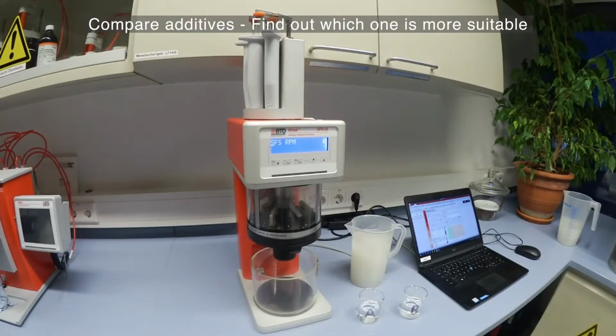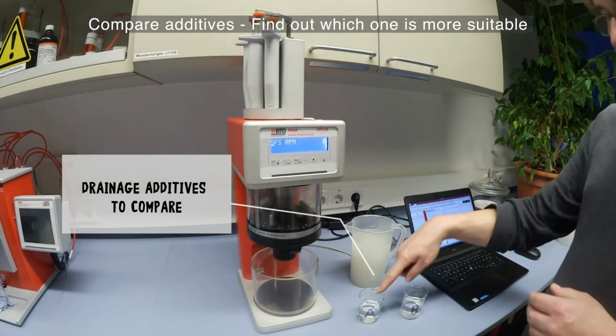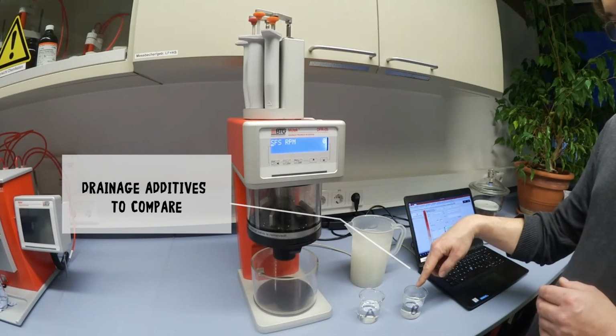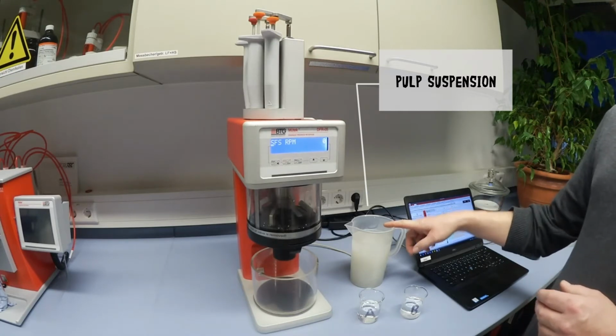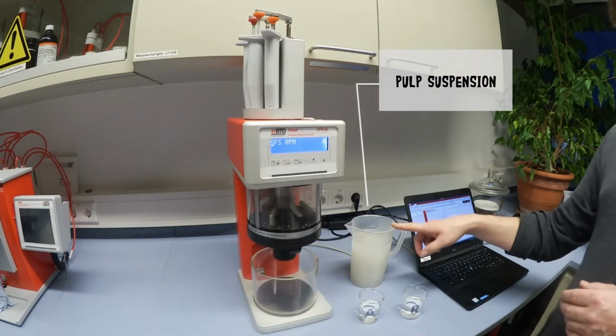This is a short demonstration on how additives are tested using the DFR 05. We will be comparing additive A with additive B to find out which one is more suitable in improving the dewatering of the pulp suspension, which is about 0.5% headbox sample, still free from retention or drainage additives.